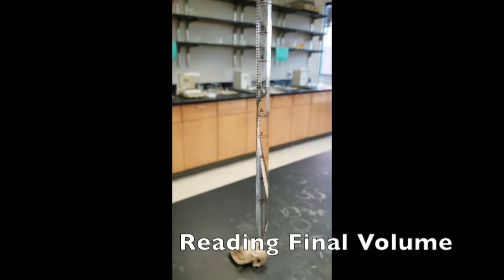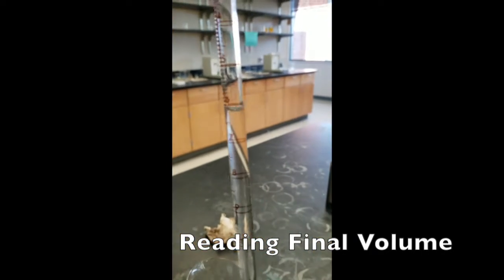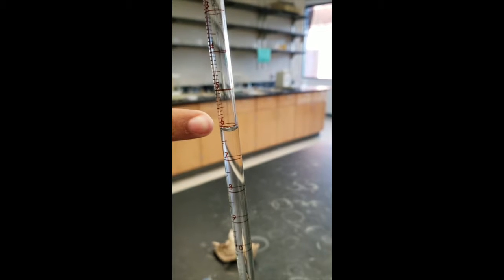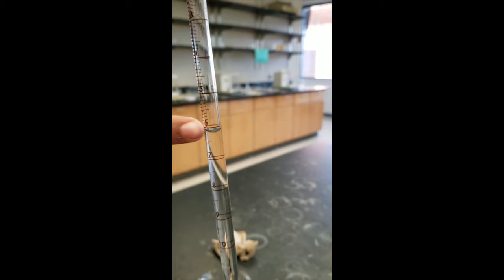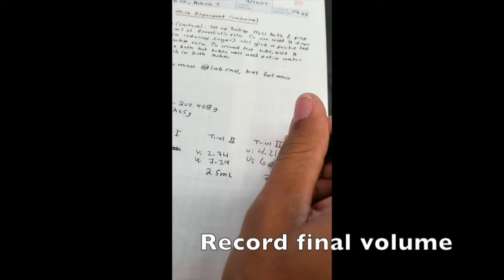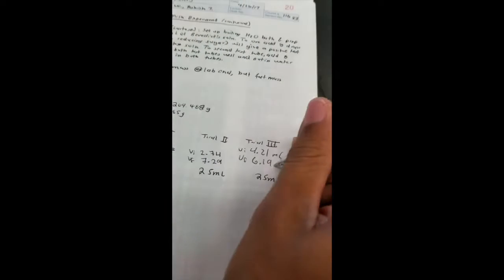So now our final volume, by reading the bottom of the meniscus, is 6.19. So now I'm going to record 6.19 ml.